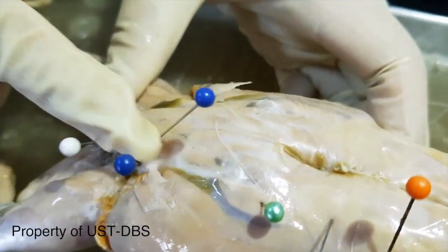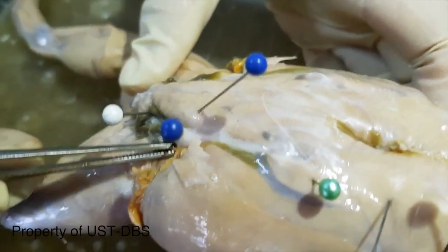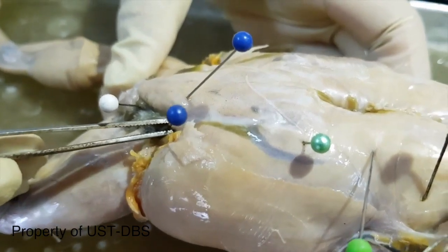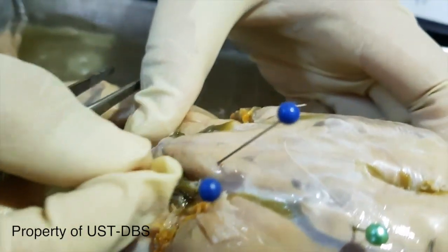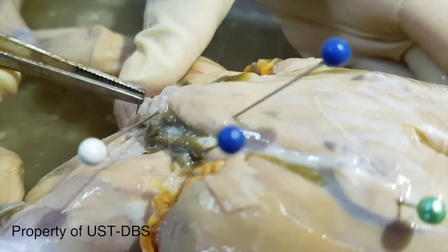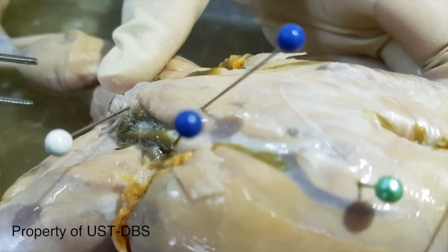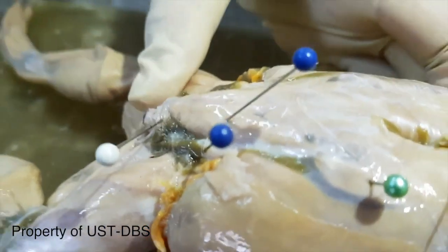This one, the blue, is the coccygeal iliacus. This muscle here is the gluteus, and this small muscle towards the vent, very small muscle, is the piriformis. Okay? Alright.